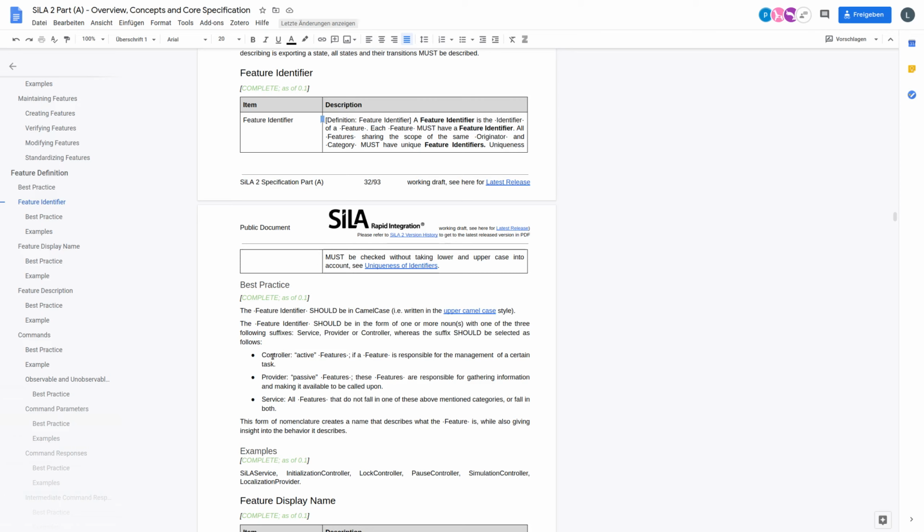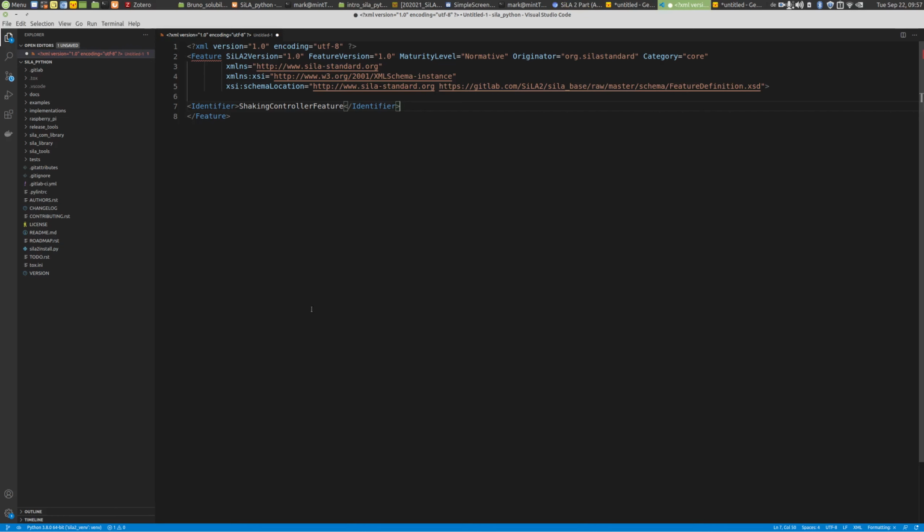We have different endings of these names for different use cases. So we have controllers for active features, providers for passive features, and services for features that do both: actively control something and also just provide some data information. For example, this is how you should name these features, and you should use camel case as I did here in this example.